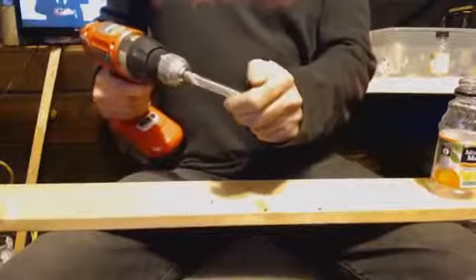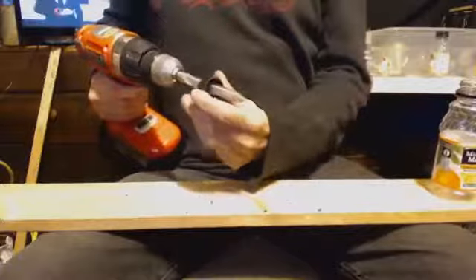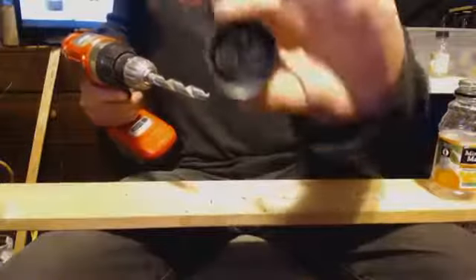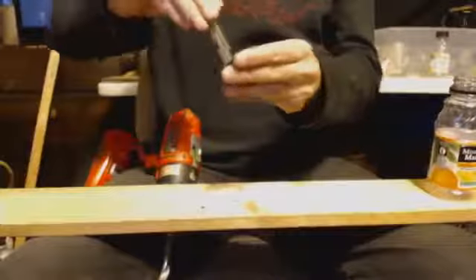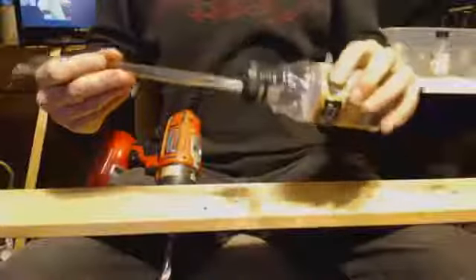Now, once you've got your two holes, just get the tubing and shove it in there, and make sure it's nice and snug. And you saw the diagram I drew, so you know the first tube goes in just a little bit into the bottle, and the next tube goes all the way to the bottom, and then you just alternate. One tube has both going to the bottom, next tube has both sides going to the top of the bottle.